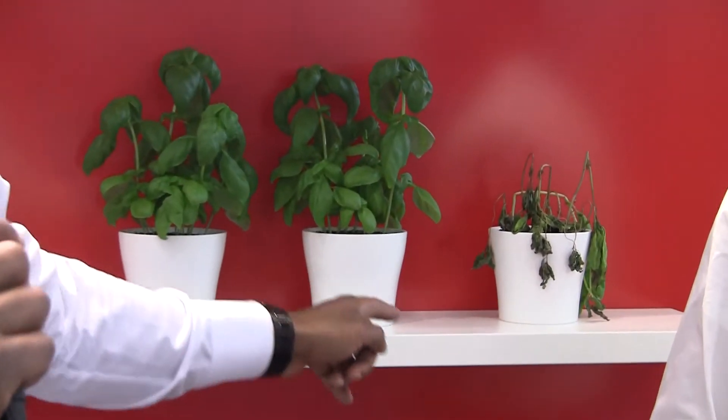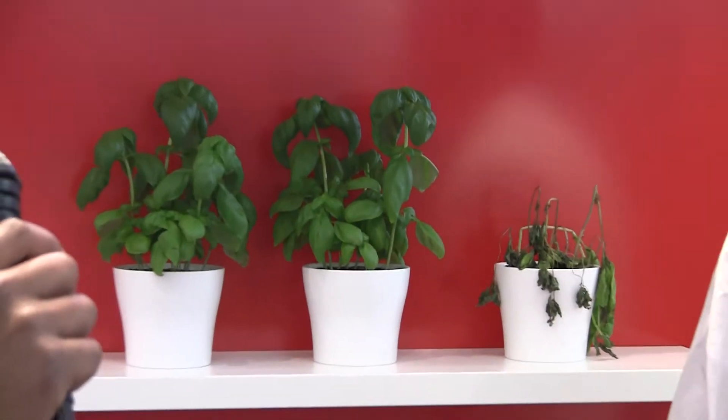I'm sure some of you are wondering why I'm kneeling behind some plants, and one plant is dead. Well, I'm going to let one of our customers, Tobias, explain a little bit about why we have these plants here.